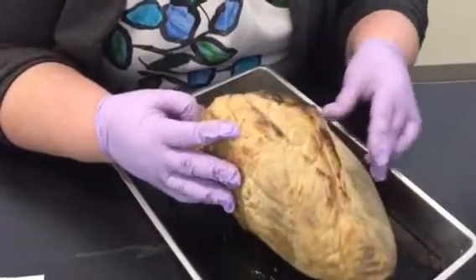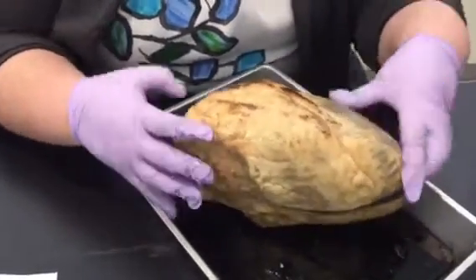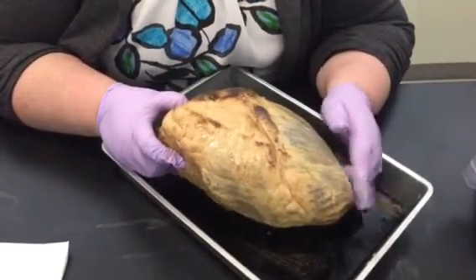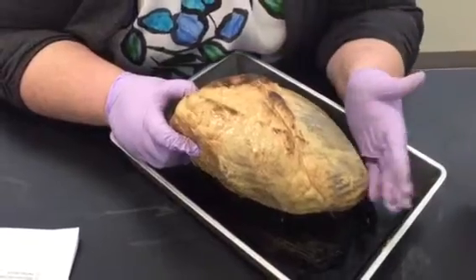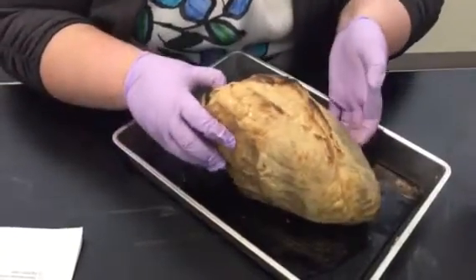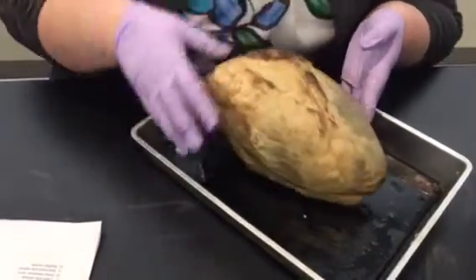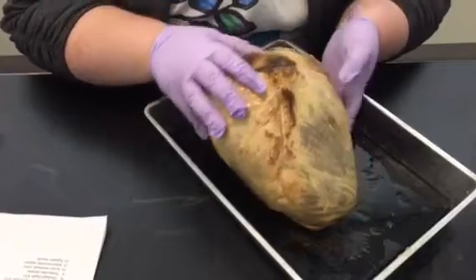How do you tell the difference between the front and the back? On the outside, there's a simple way. The apex points to the left of the person who owns it. So find where the side is longer — if it's pointing that way. This is the anterior side of the heart, this is the front.